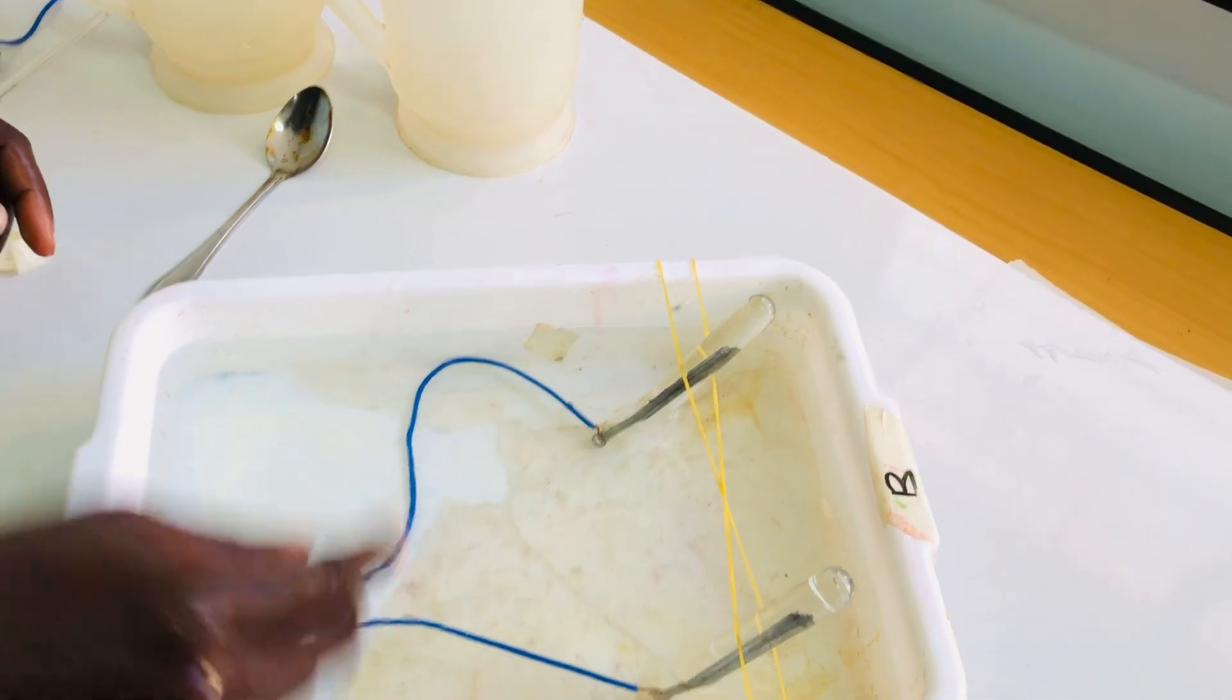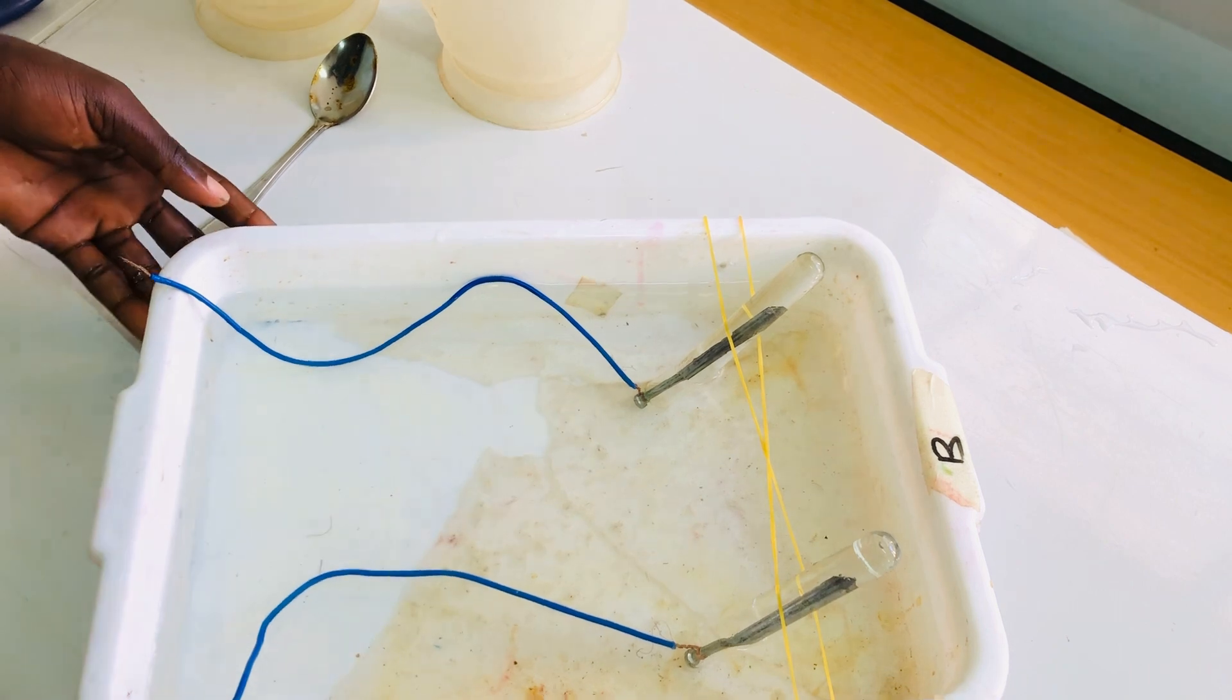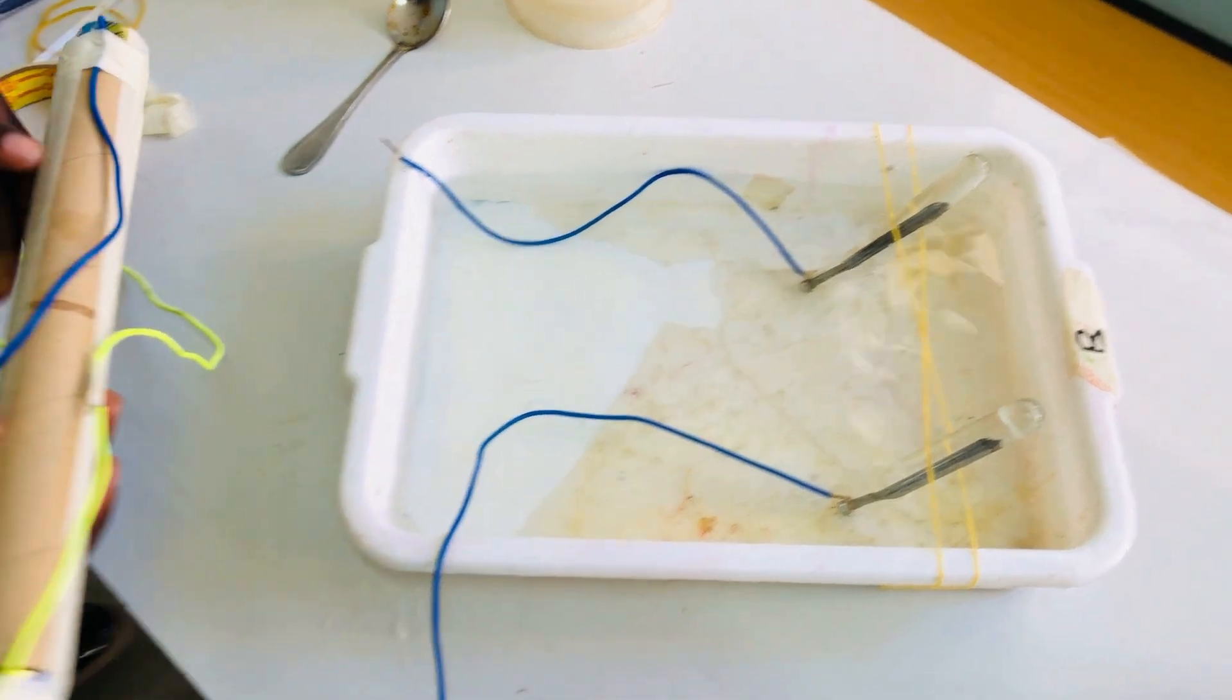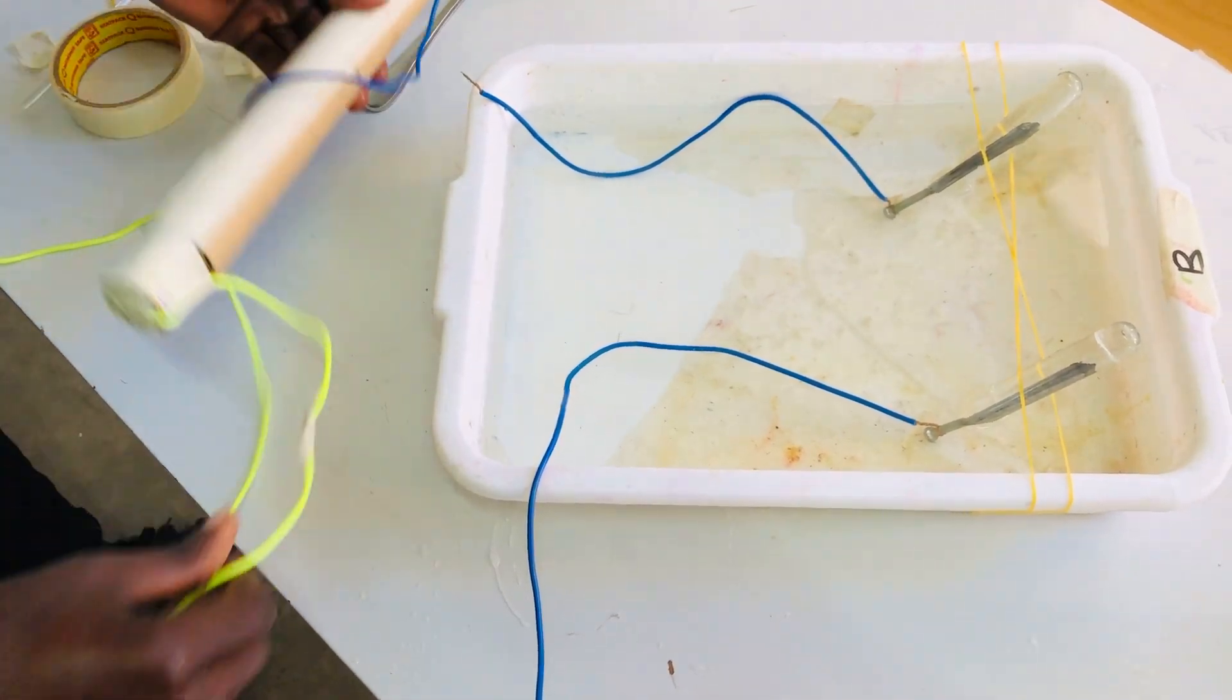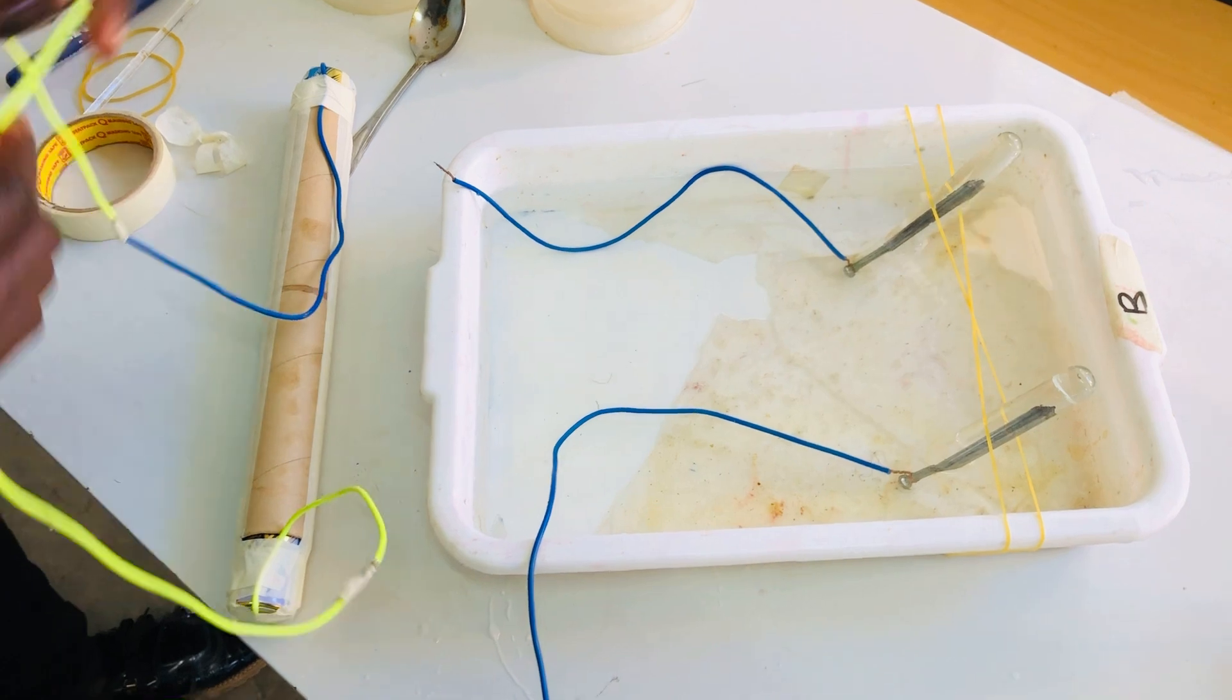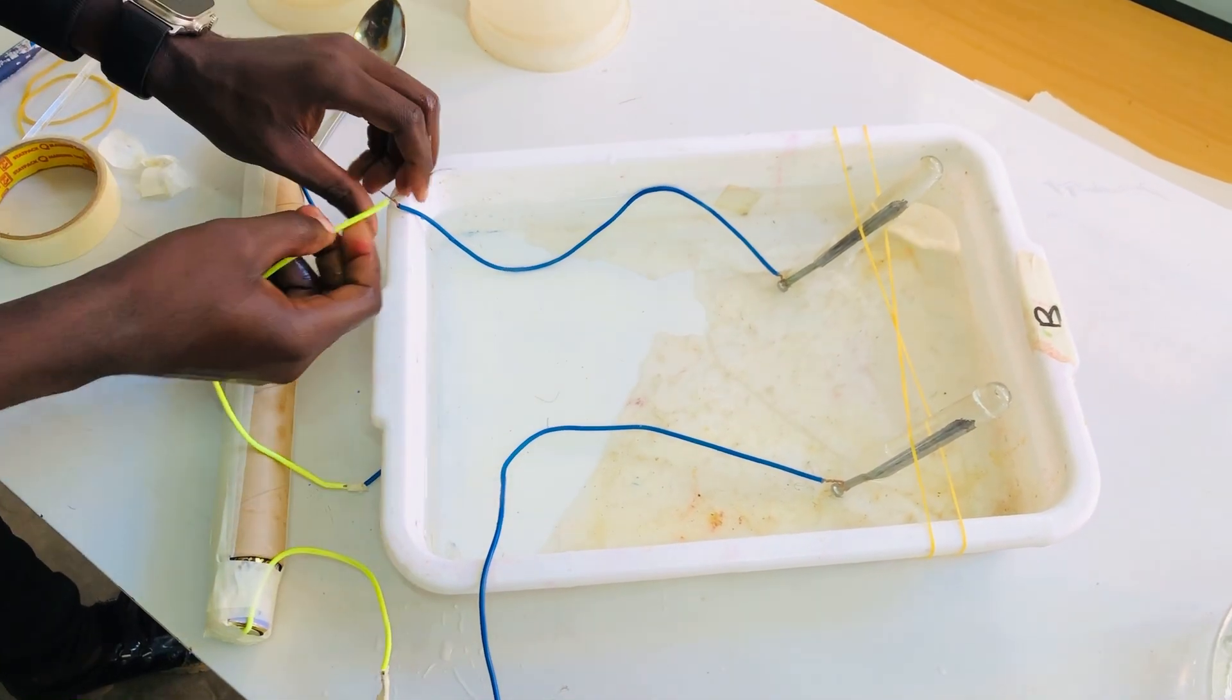One of these is going to collect oxygen gas and another one is going to collect hydrogen gas. This one is a source of current, the use of current to drive non-spontaneous reactions, so I'm going to connect it.